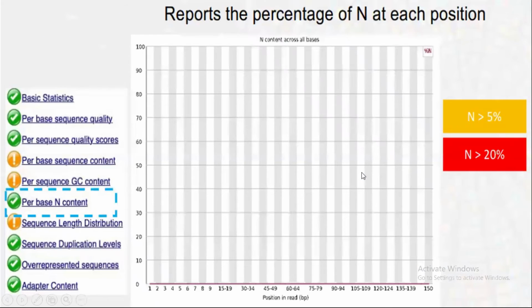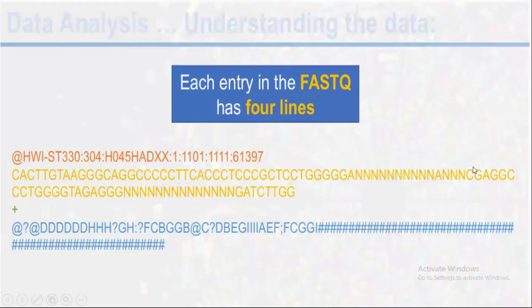So ambiguous calls are also very important to remove from our sequencing reads. Okay, so per base sequence N content. Now here, if you have no ambiguous calls in your sequence reads, this line will be just like this. From 1 to 150, there is no N content. When it is more than 5%, it is a warning, and if it is more than 20%, then it is an error. So keep this in mind.